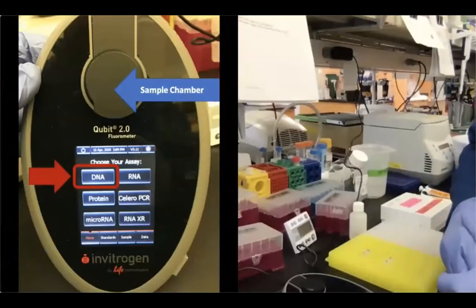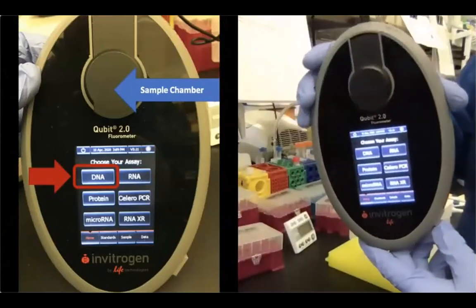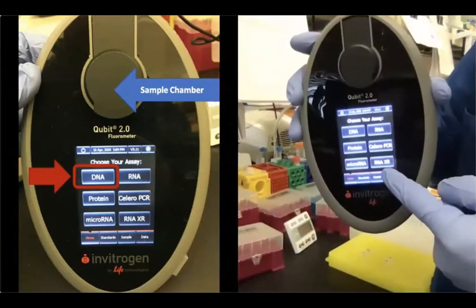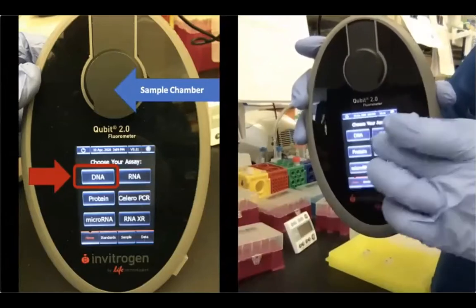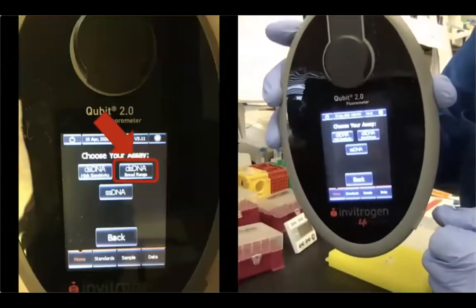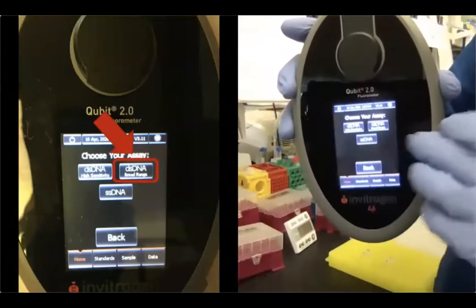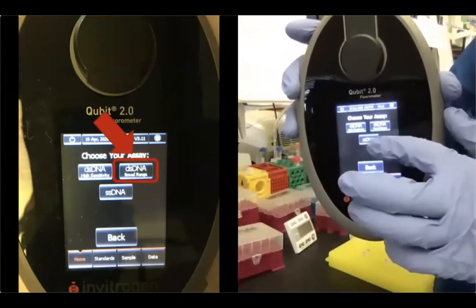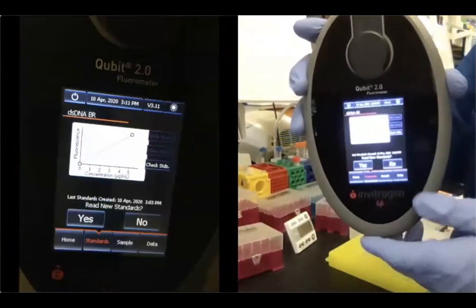Okay, so the incubation is almost done. I just want to show you the Qubit, how it looks. So as soon as you plug that in, you have all the different assays that you can perform. Today we're gonna push DNA, and then you have other assays you can choose from. It's double-stranded DNA high sensitivity, top left, double-stranded DNA broad range, top right, and then you have single-stranded DNA. We're gonna push double-stranded DNA broad range. That's the assay that we're gonna perform.